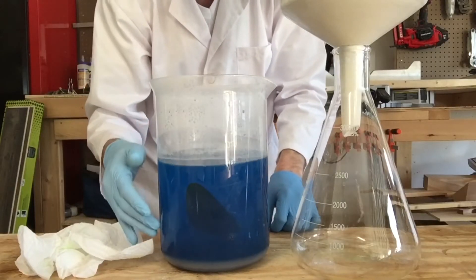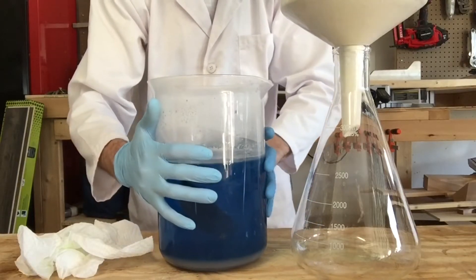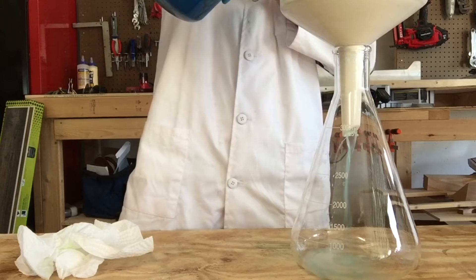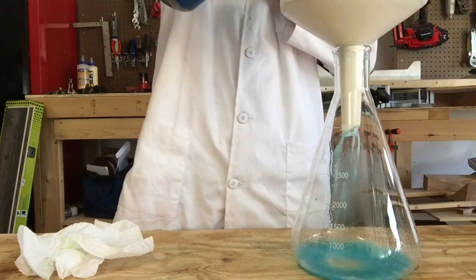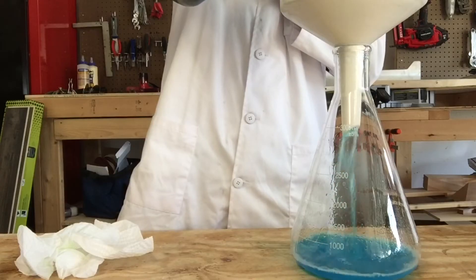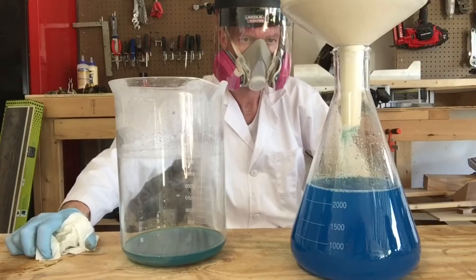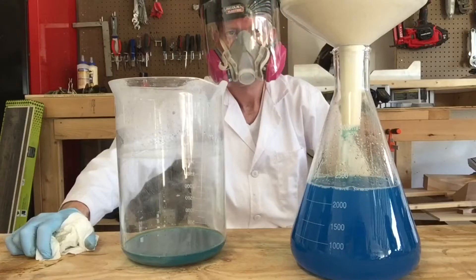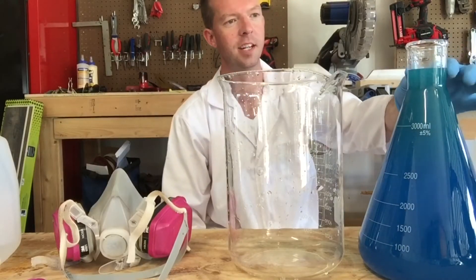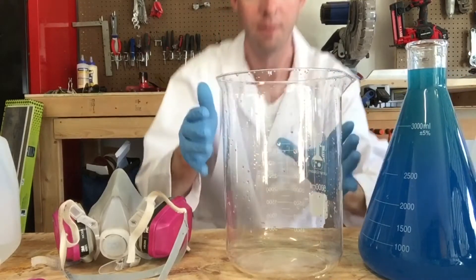We've definitely gotten all the nitric acid out of there. We still have some undissolved silver in there so we're just going to pour this out now and get any kind of solid out of there. Okay, we got everything filtered out. Luckily this beaker turned out to be perfect, so we're going to get this poured back into our big beaker now.